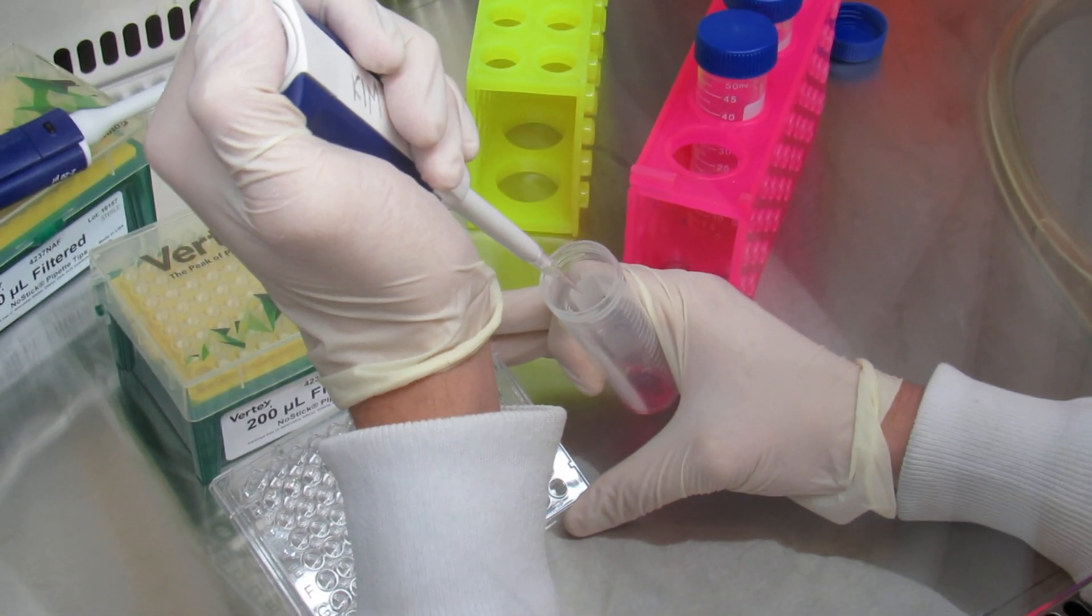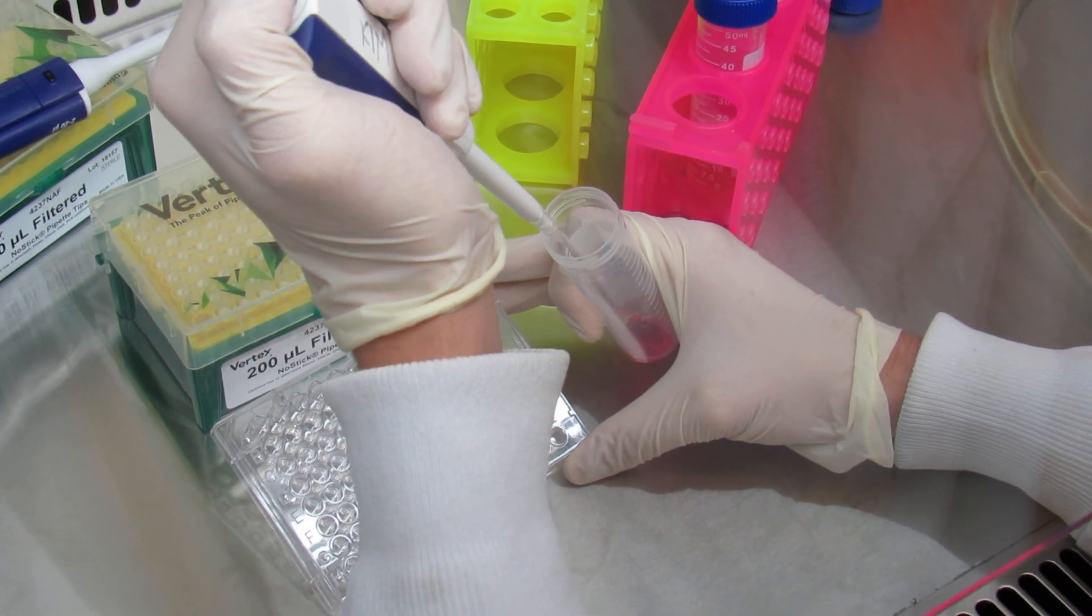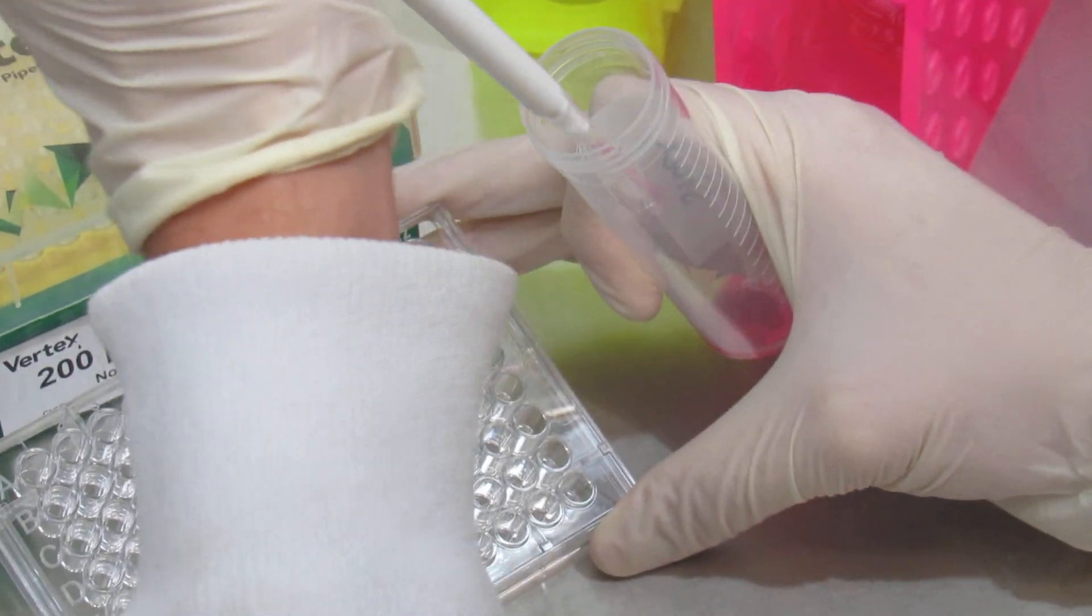Make sure to properly pipette up and down your cells and your cell stock to make sure that your cells are properly distributed.